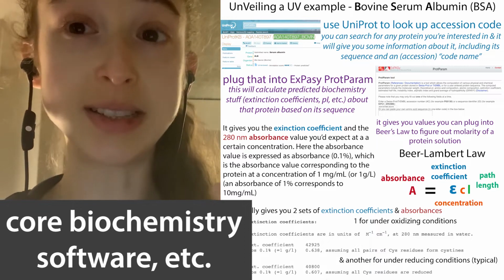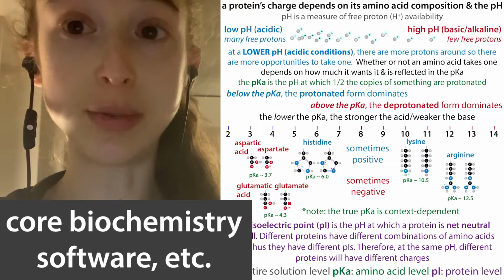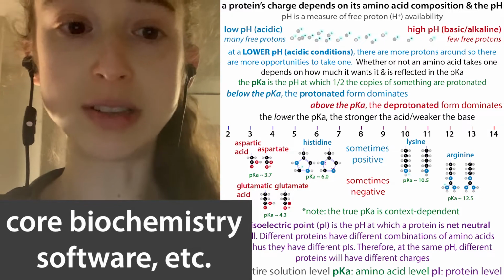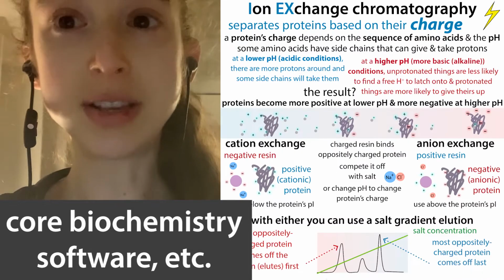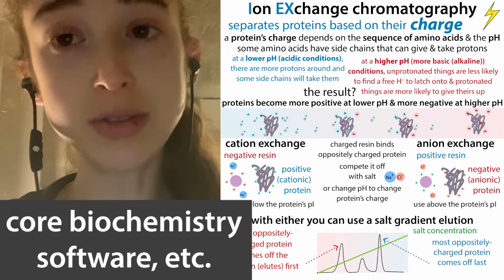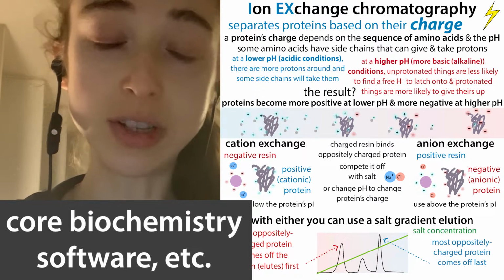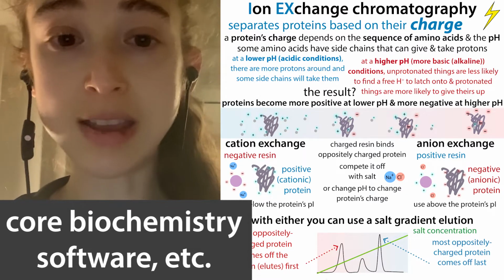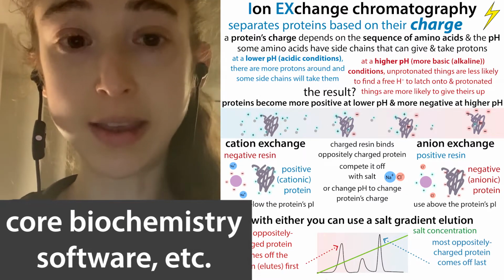It'll also tell you things like the pI, the isoelectric point, which is really helpful if you're trying to purify the protein and want to know if it's positively or negatively charged, because you're trying to purify it with ion exchange chromatography, which the kind that you use is going to depend on whether your protein is positively or negatively charged. And so that's where you go to the pI and then the pH and that sort of thing.